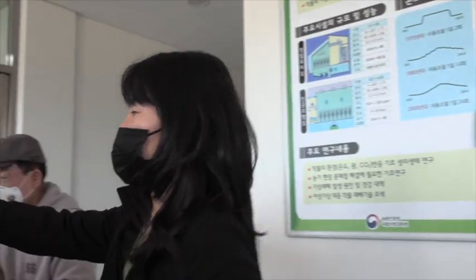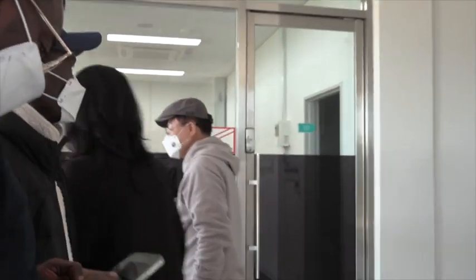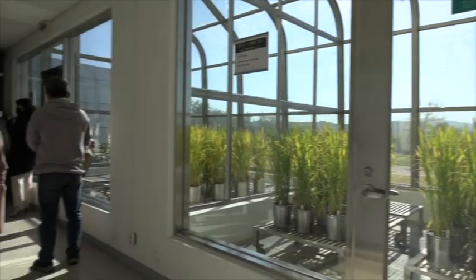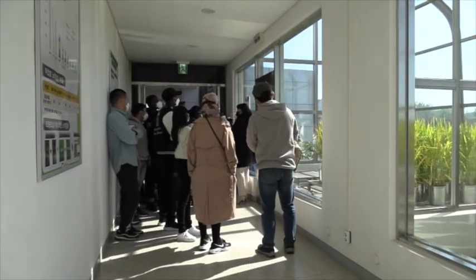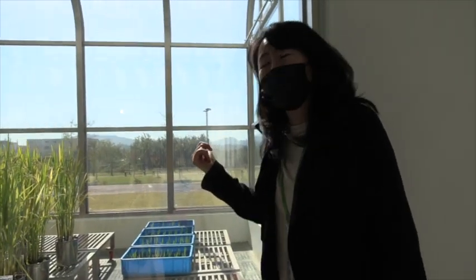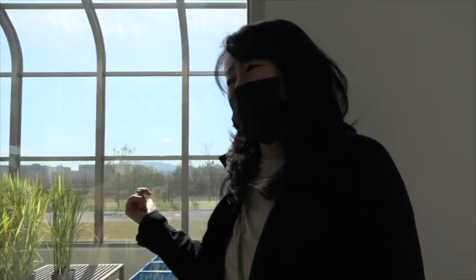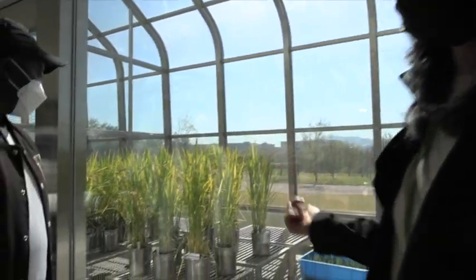I will show the plants in here. After maybe 2 p.m., we gradually decrease the temperature. The lowest temperature is for barley or wheat. So some scientists want to check the growth characters in these rooms.